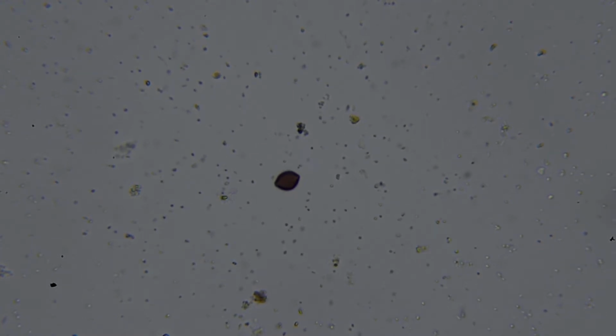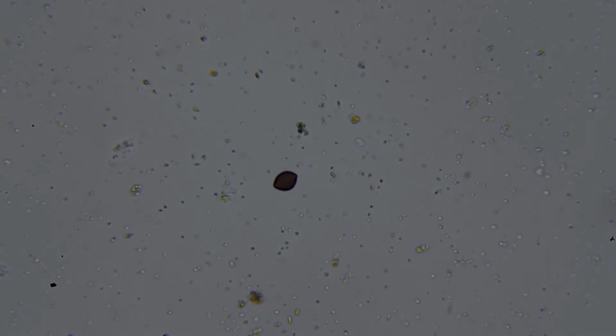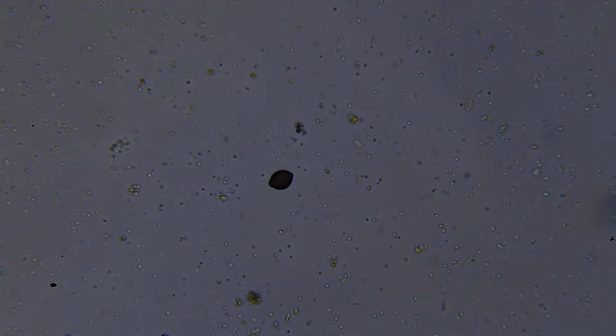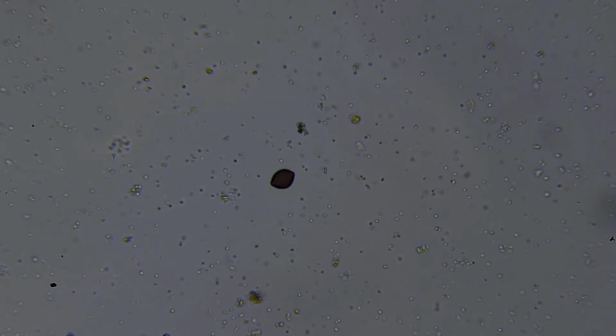This thing right in the very center, this is a fungal spore, the thing that looks like a lemon. So I think I should get it pretty nicely in focus there. Yeah, there you go. I don't believe that's a spore from a mycorrhizal fungi, i.e. the fungi that form an intimate connection with the plant's roots, be that endo or ecto mycorrhizal fungi.